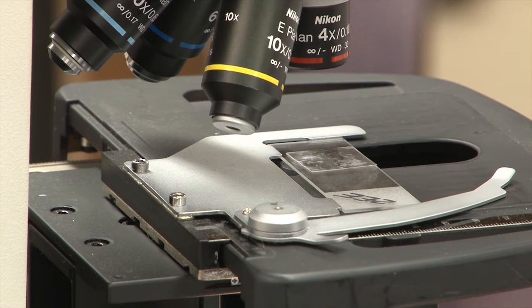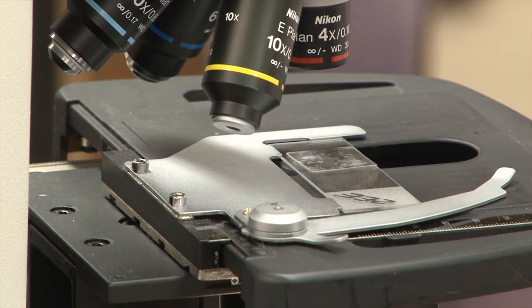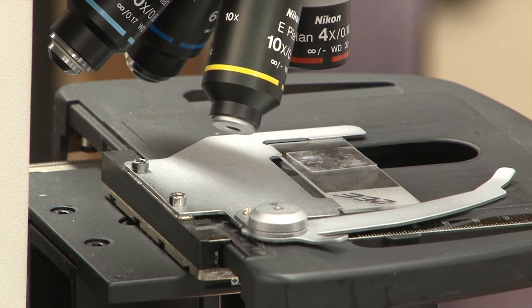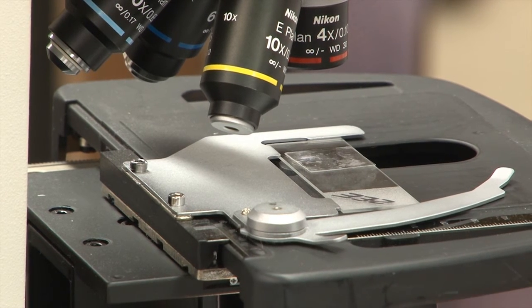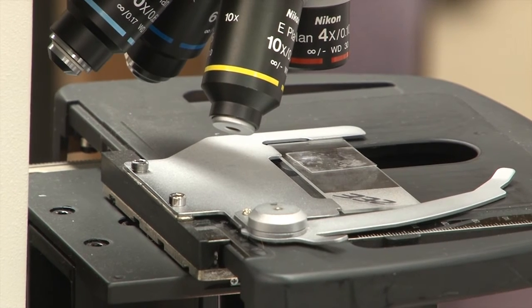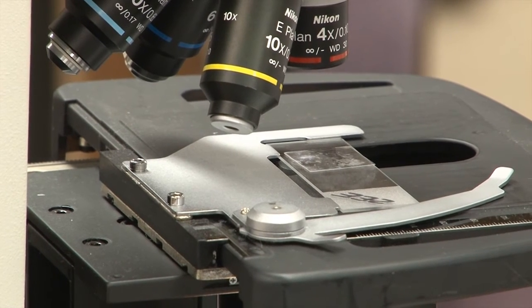You move in a grid-like pattern, kind of like how you would mow a lawn, to make sure you don't miss any spots on your slide. You want to be able to see everything.